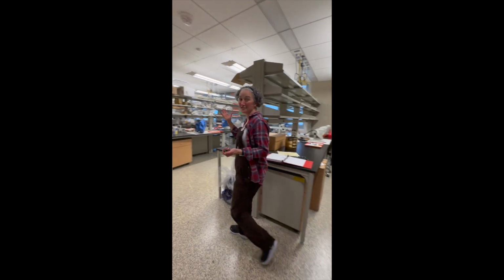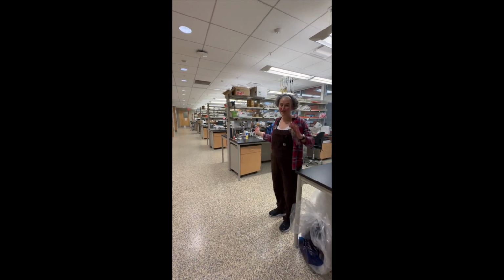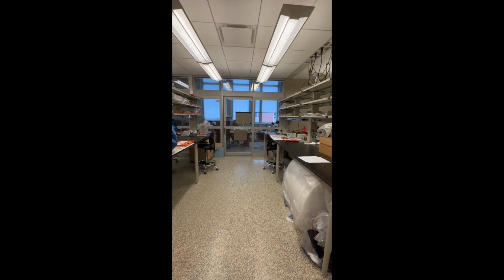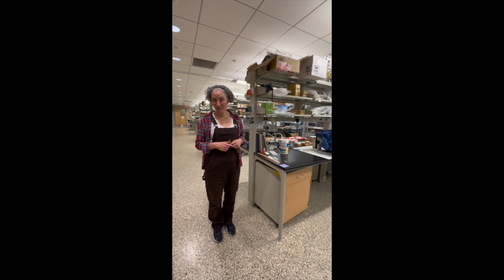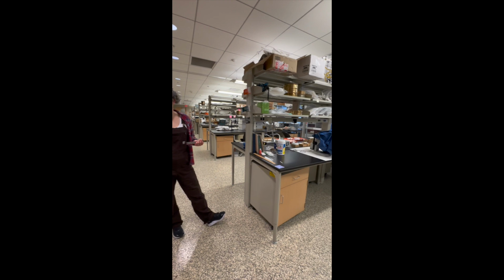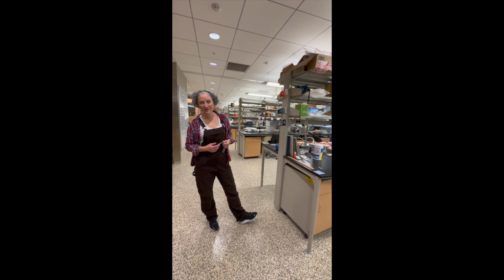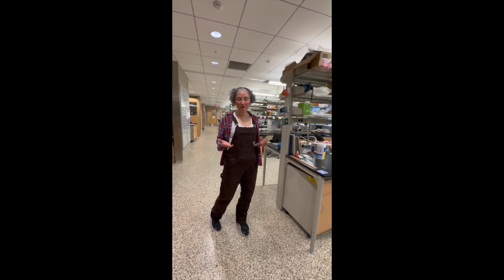So in our larger archaeology lab, the paleoethnobotany portion is this section here that's closest to the elevators. We have several stereoscopic microscopes that I use partly for class. I teach a paleoethnobotany class, currently this spring semester, but usually every other year, where we go over paleoethnobotanical method and theory, and look at a lot of different samples. But we also use it on research projects, and we take in samples from archaeologists all over the Southeast.